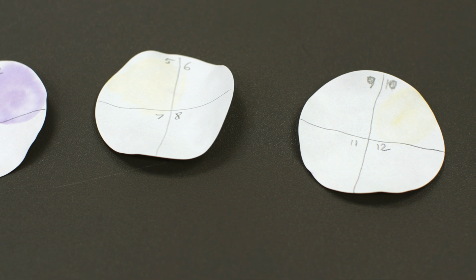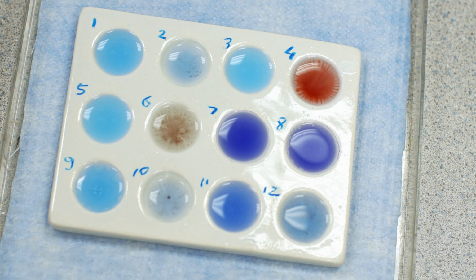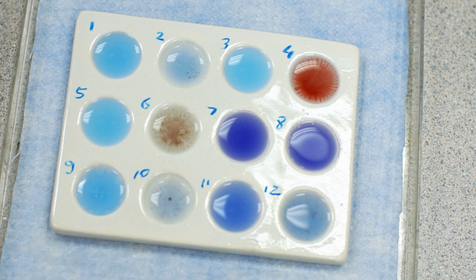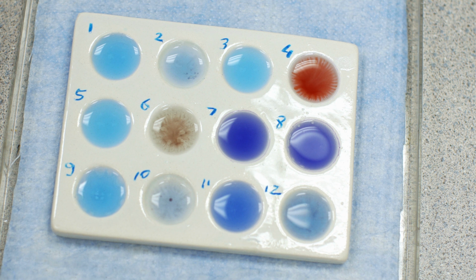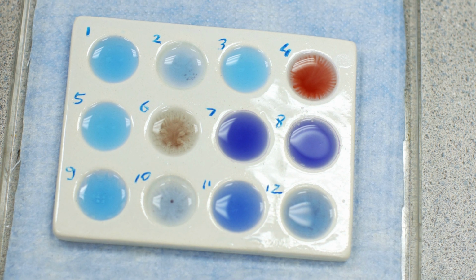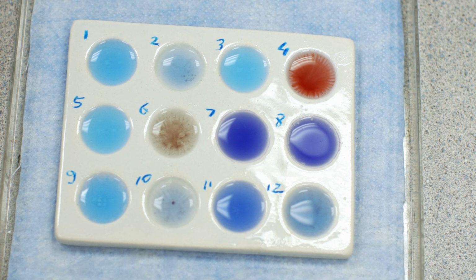So whoever has unknown 3 and 4 does not have, in this case, amino acids in them. Okay, and so one more test here, biuret, the qualitative biuret, not the quantitative one we just did, but the previous one. A positive result would be a purple lavender color, right? A negative would be if it stays blue. So you can see here in the tray that most of these are negative for protein. There's only a couple here.